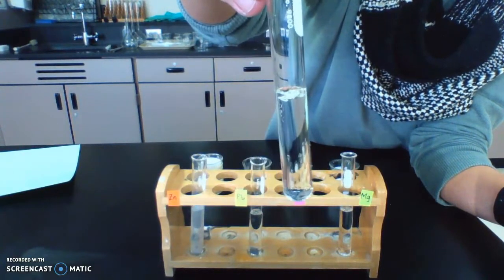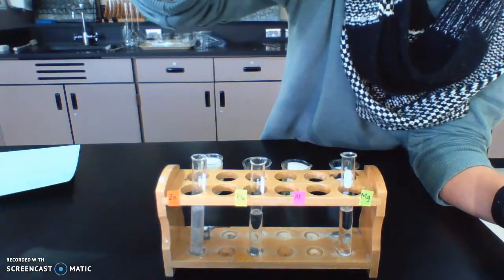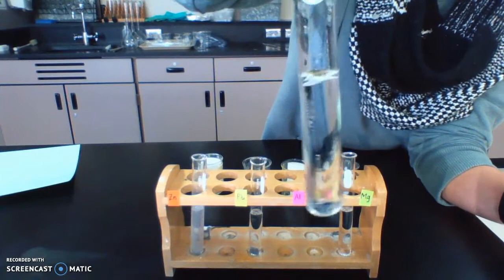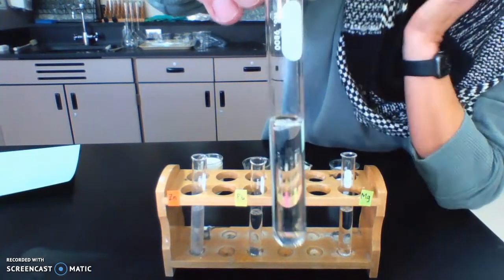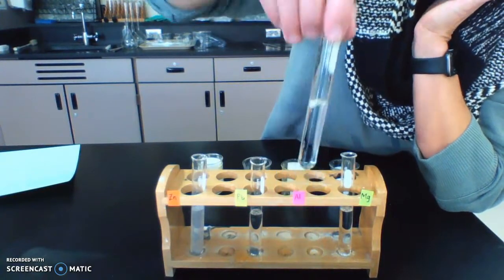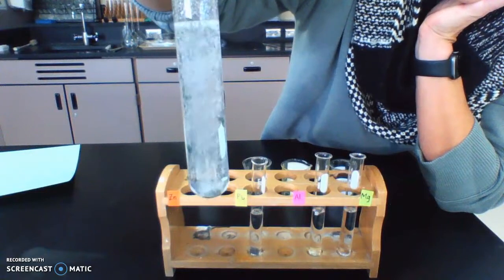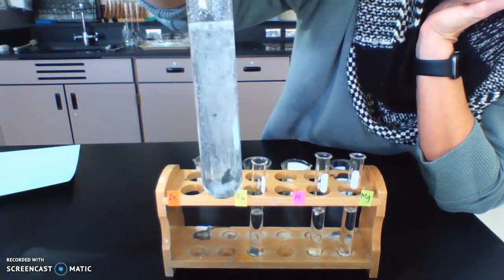See if this will react. Sometimes, I mean, that's why I left the lead in there. Sometimes things don't happen right away. I mean, the zinc didn't happen right away. Set this down for a minute. But it's clearly reacting now, right? We've got gas, got bubbles.